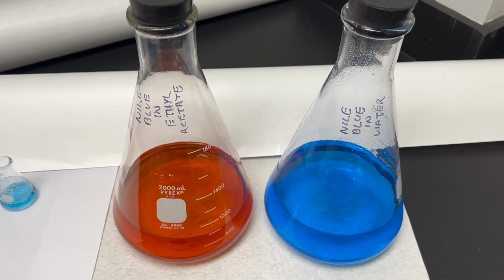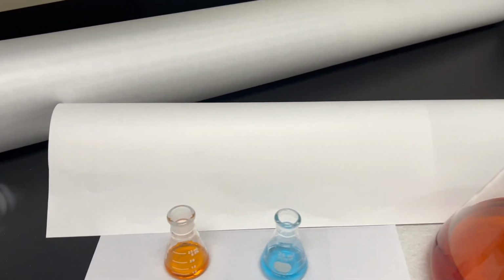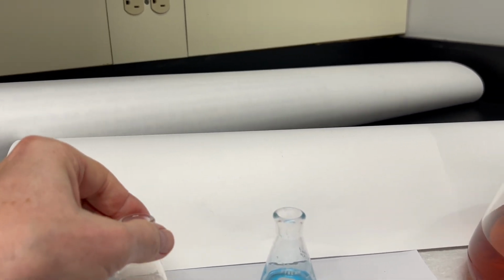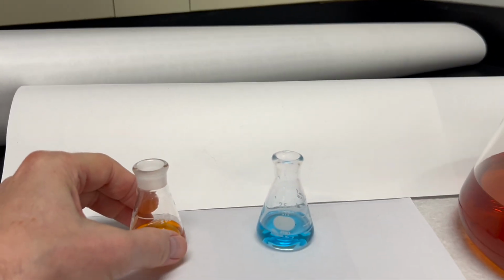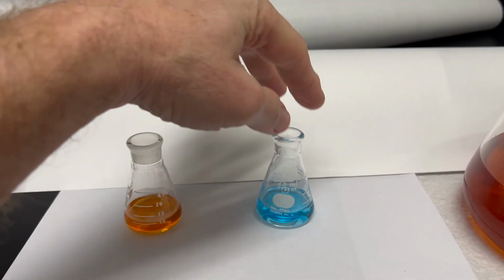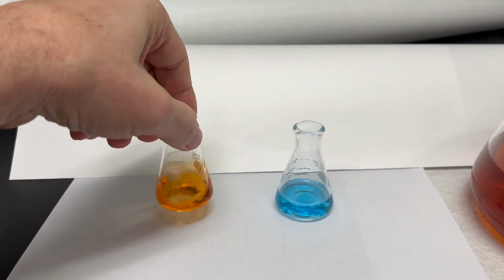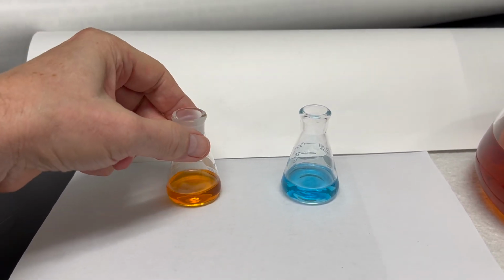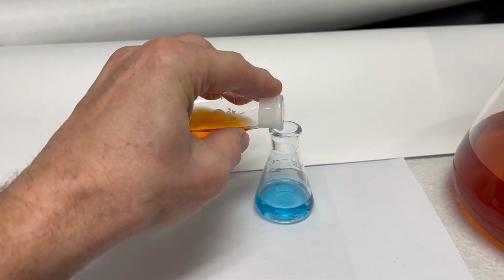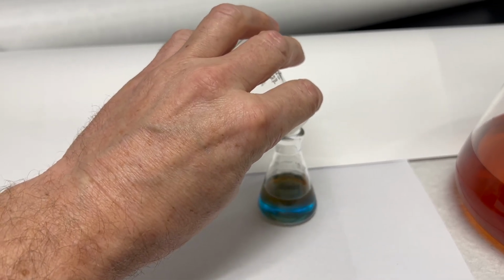Nile blue clearly dissolves in both ethyl acetate and water, but what about ethyl acetate and water? So we'll put a little of those two solutions in these cute little Erlenmeyer flasks. Gotta admit, that is some good looking labware there. And does ethyl acetate dissolve in water? Well, let's pour it in there, take a look at what happens, and sure enough, the two don't mix.